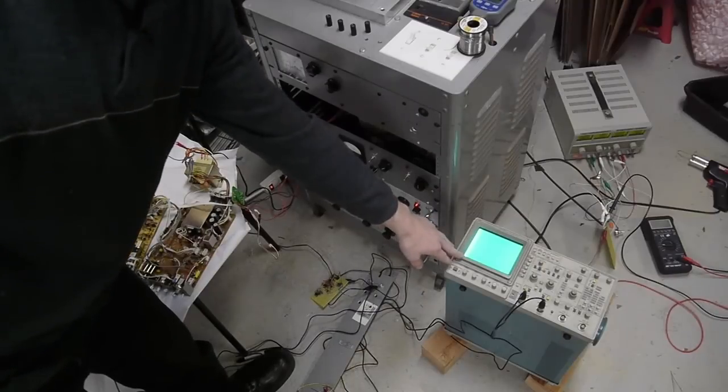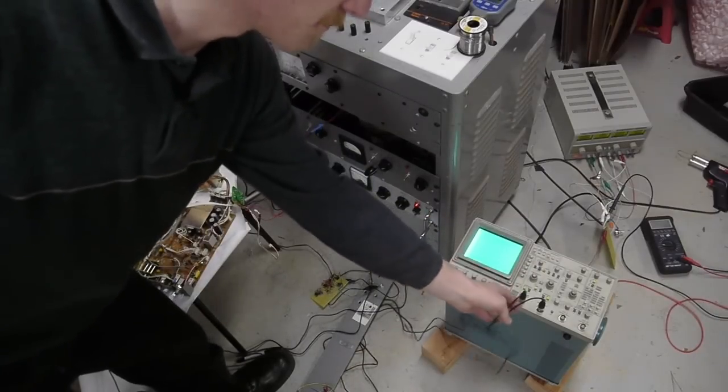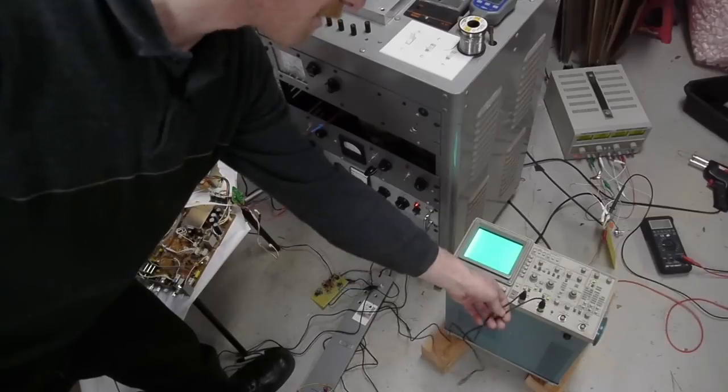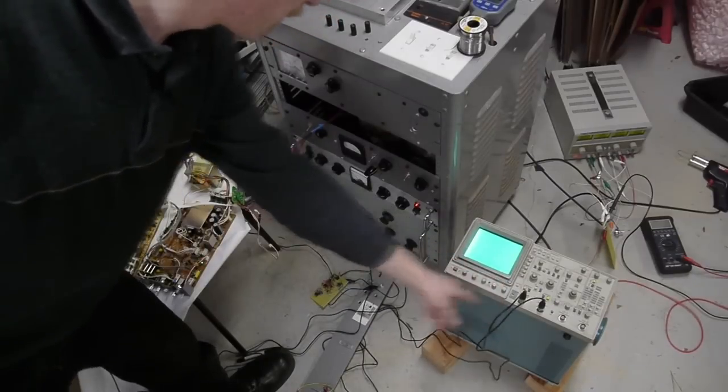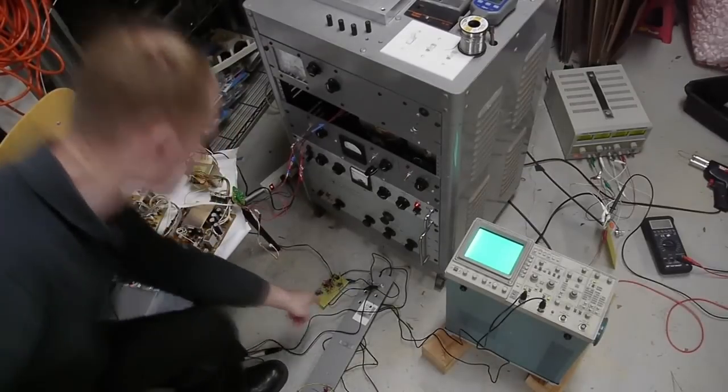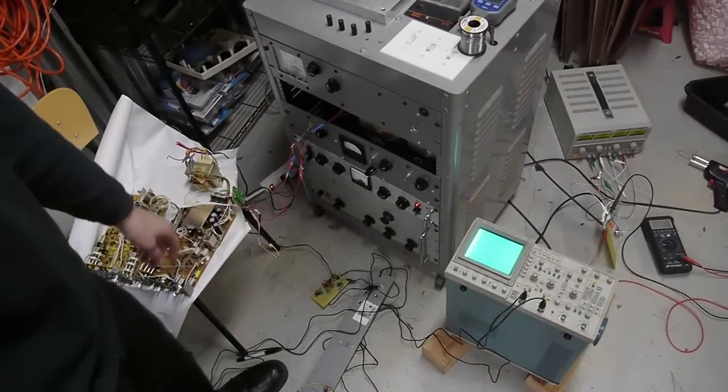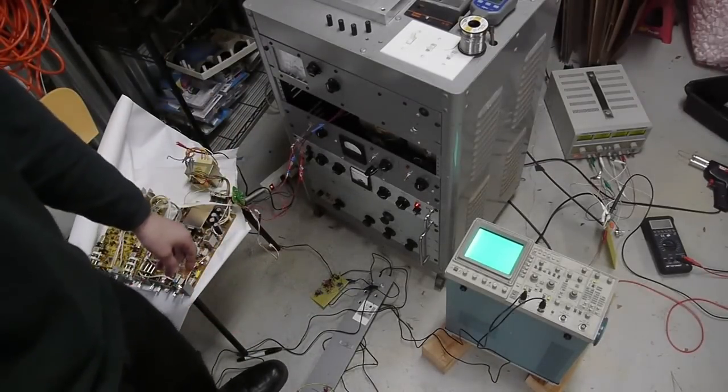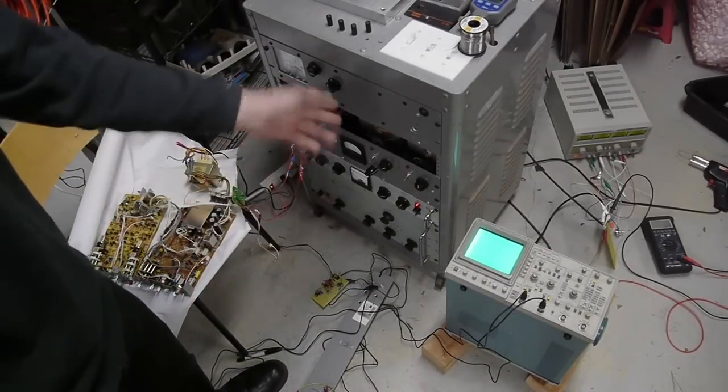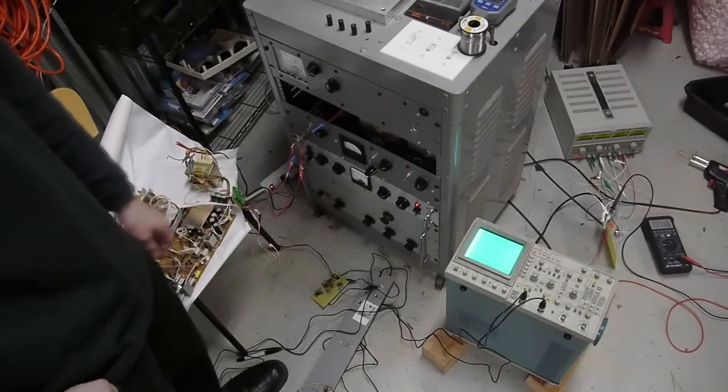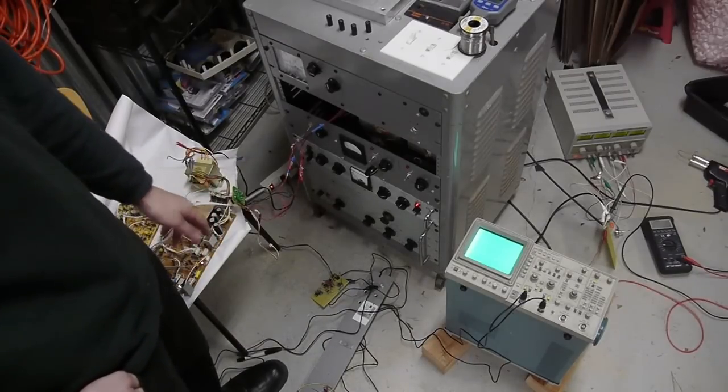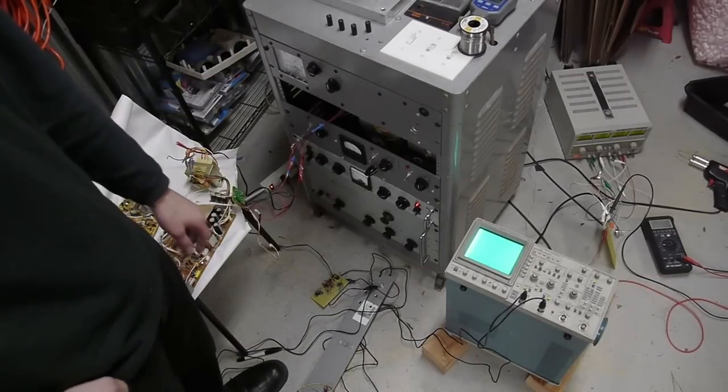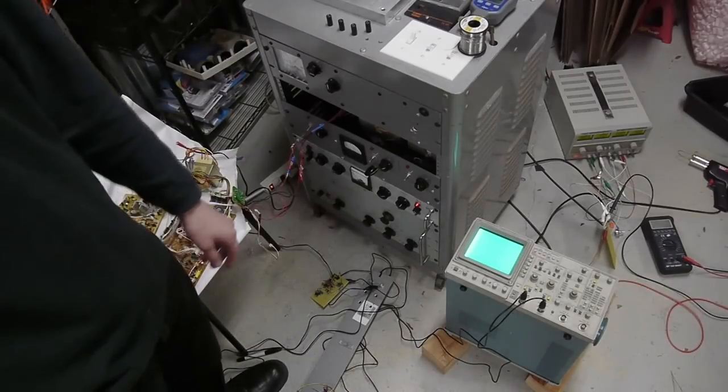It's operating in XY mode, and the X, or the channel 1 and 2, X and Y are coming from this small signal generator, which is a raster scan generator. It's moving the Y-axis at about 60 Hz and the X-axis at about 15 kHz, pretty similar to TV scan rates.